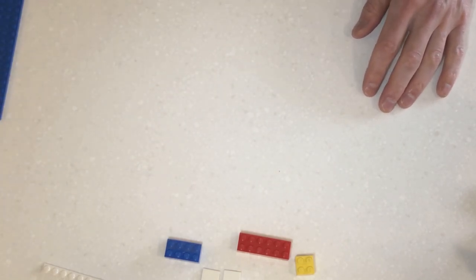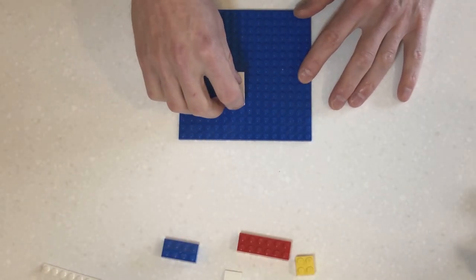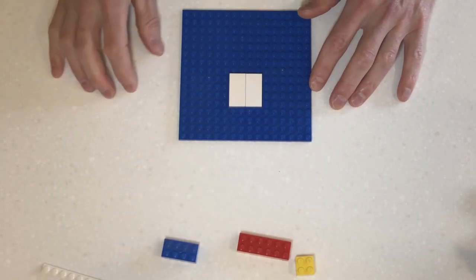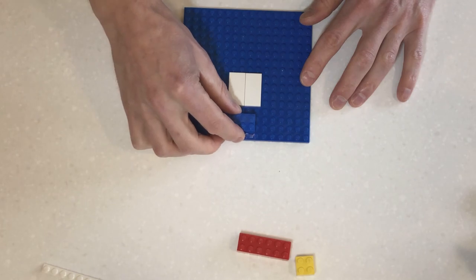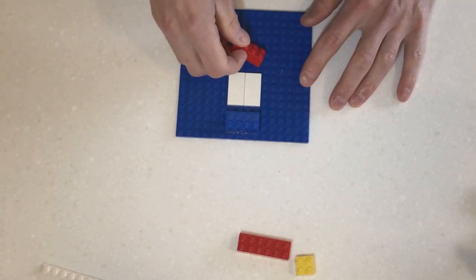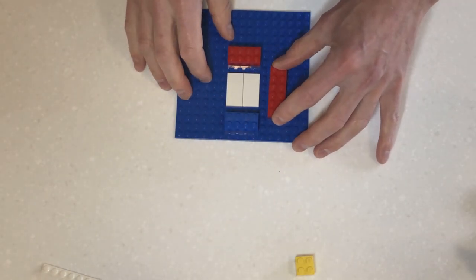Okay, so let's get building. So first off, let's make our stage. If you position this centrally, it should be fine. And now we're going to build the body of the microscope around it. I use the smaller Lego bits, top and the bottom here, and along the side, I use the bigger Lego bits.